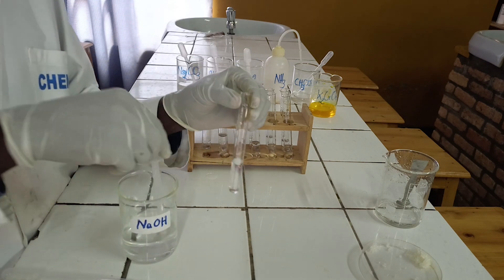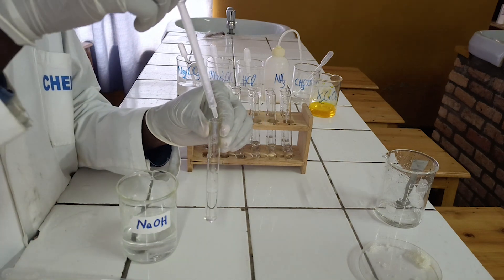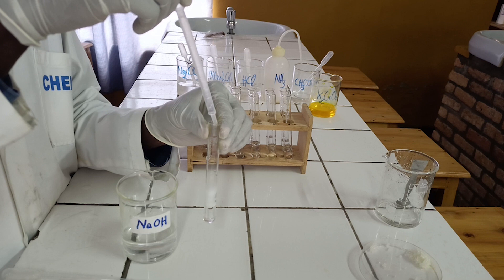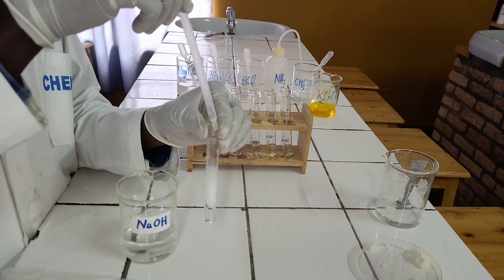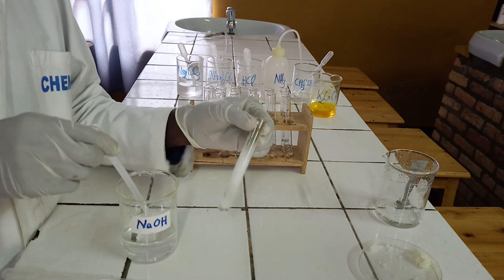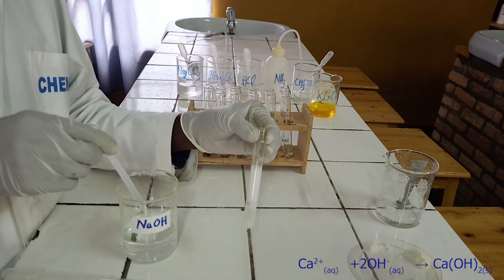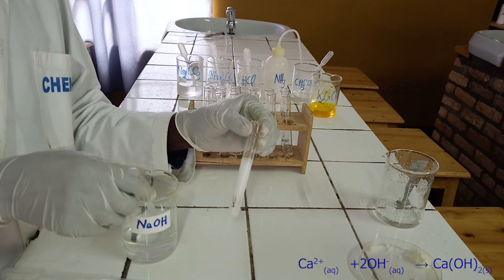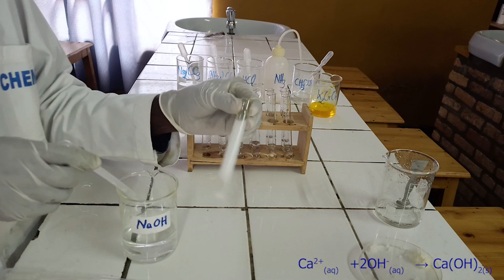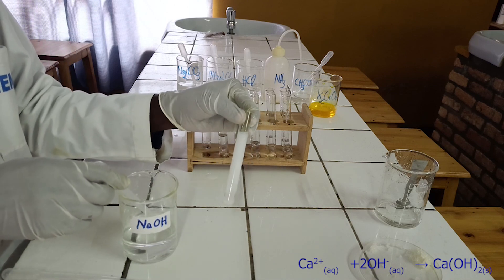To the first test tube, add sodium hydroxide solution dropwise until in excess. As you see, sodium hydroxide reacts with calcium ion to form a white precipitate, which is insoluble in excess of sodium hydroxide. Below, there is an ionic equation for this reaction.